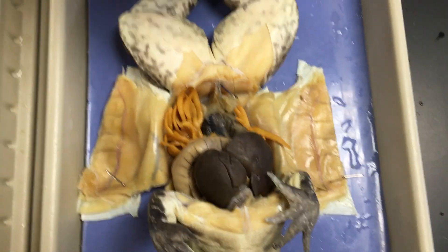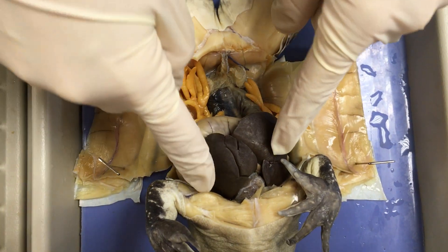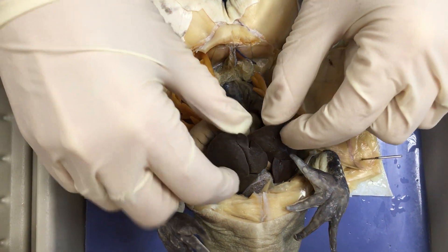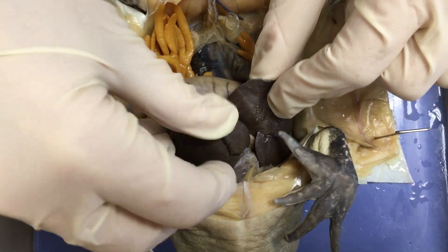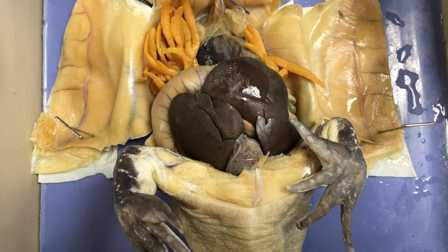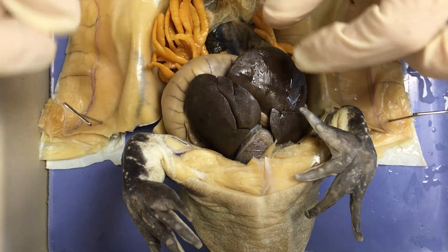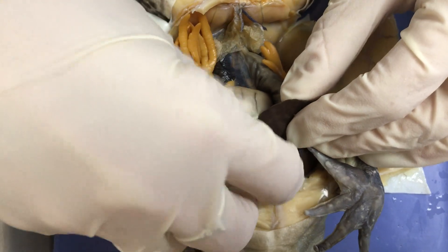The most obvious organ when you open up the frog is going to be this big three-lobed structure here. This is the liver of the frog. As you can see, there are three different lobes. It serves the same function as it does for us — it helps to produce bile and begin aiding in digestion. It's fairly large, so we're going to go ahead and get that out of the way.